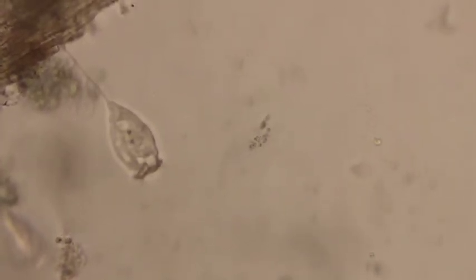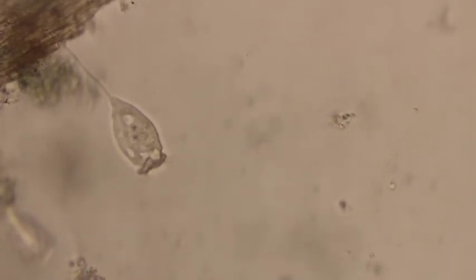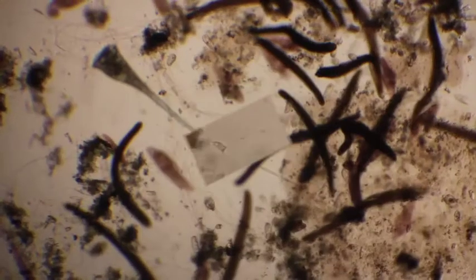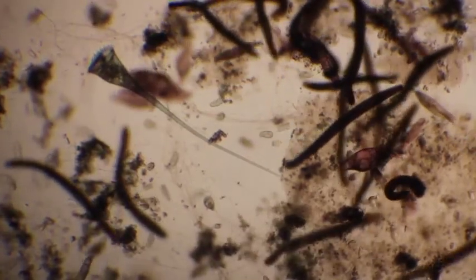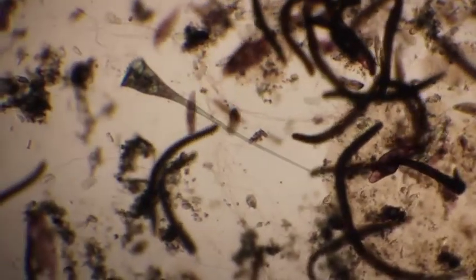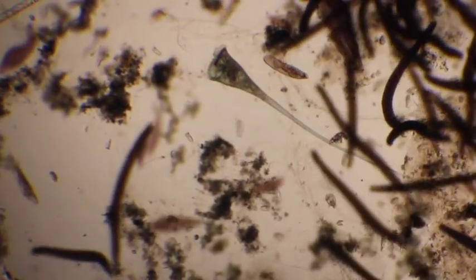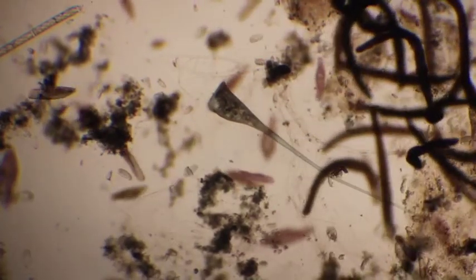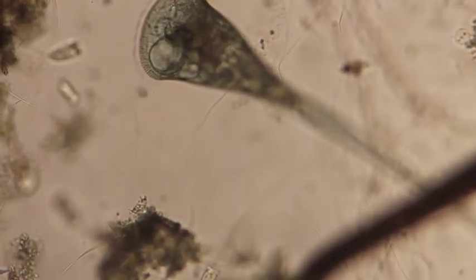So the Vorticella is a single-celled organism. It's larger than a lot of the other cells that it's eating, but it is much smaller than the amoeba. I want to focus in on this guy, the greenish guy with the super long stalk there. It's a single-celled organism. All of these are single-celled organisms. That means they're made up of one cell. There are other things in here that we'll look at in a minute that are multi-celled organisms that occupy a very similar niche to these guys.